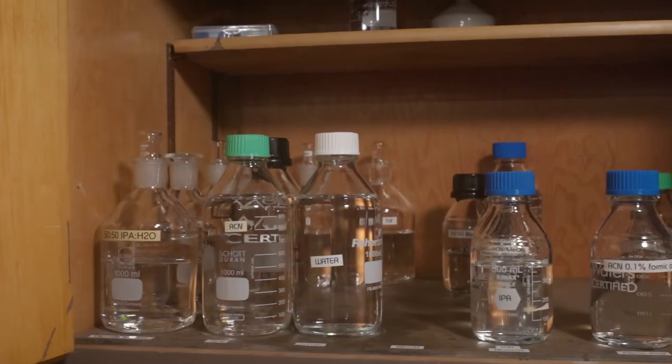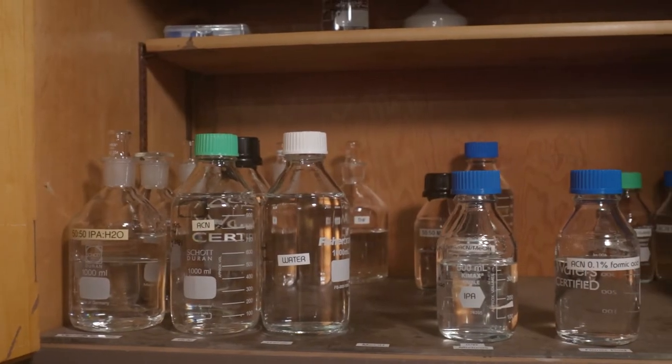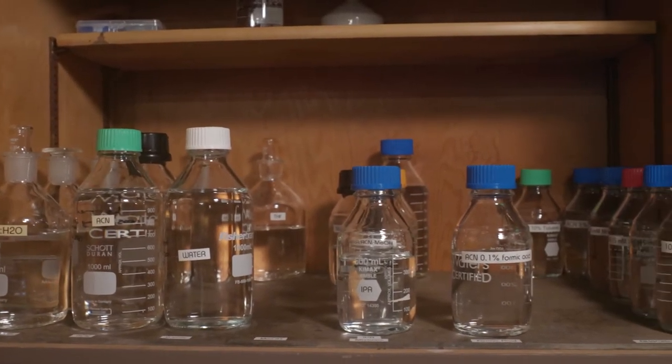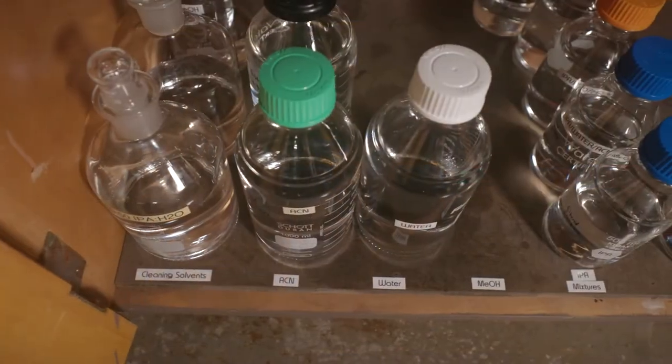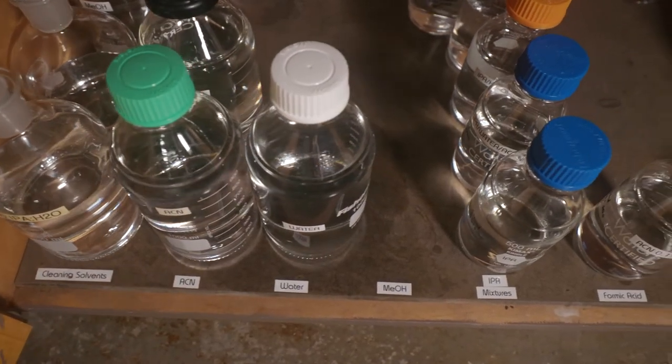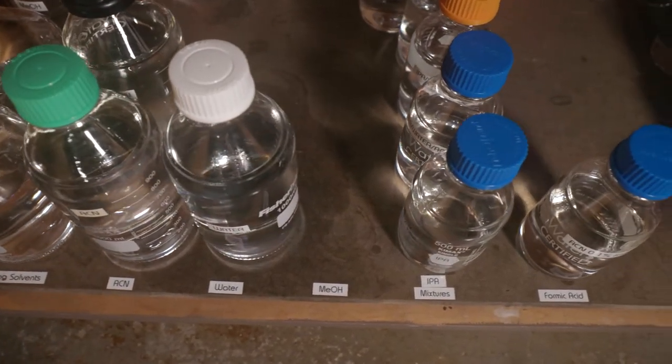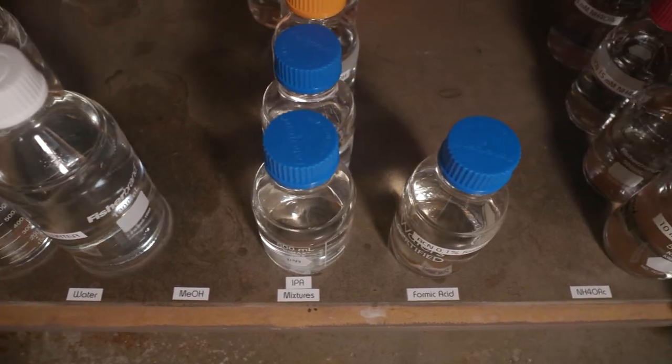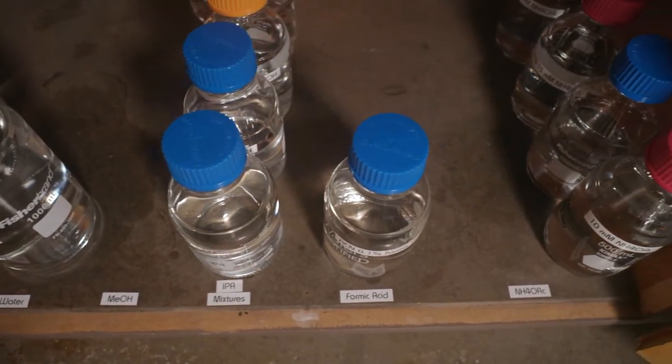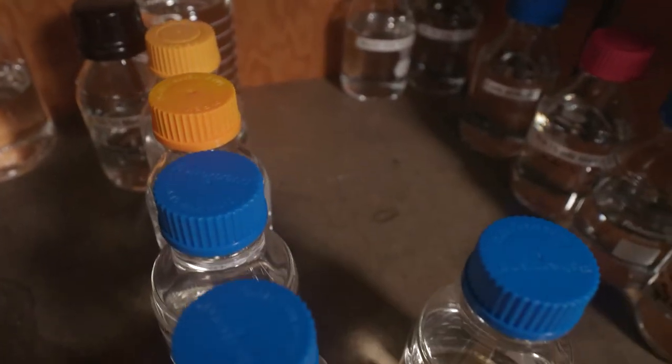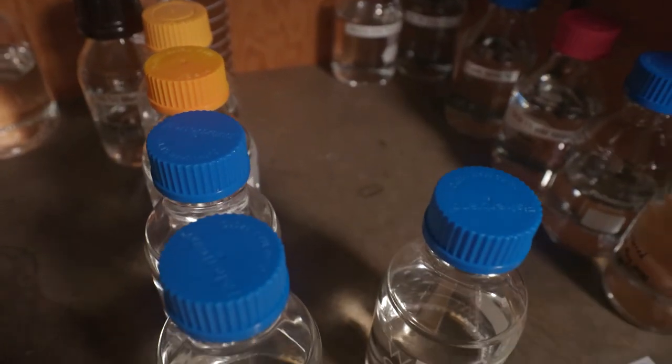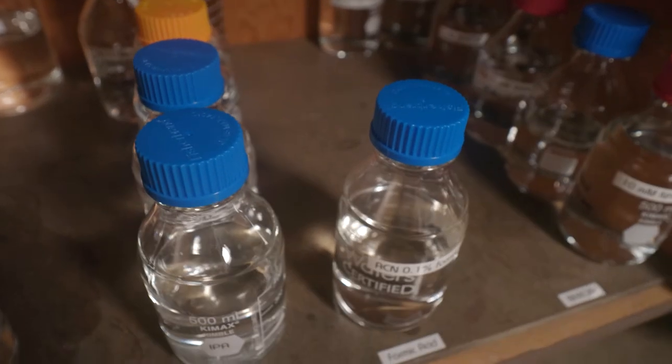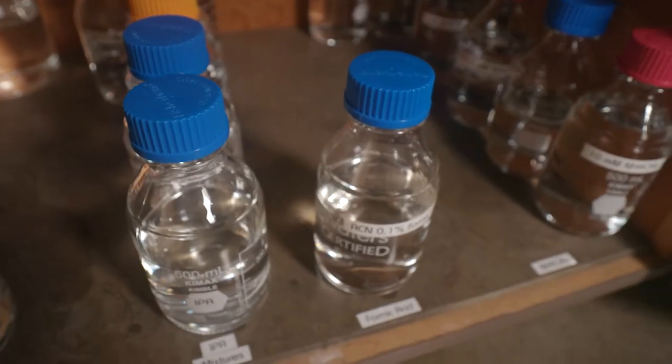If you need a different bottle, you must use solvent from our dedicated LC-MS solvent cabinet. These bottles are filtered specifically for LC-MS. Do not top off these bottles or use any other bottles. If the solvent you need is unavailable, please let an ARC-MMA staff member know via Teams.